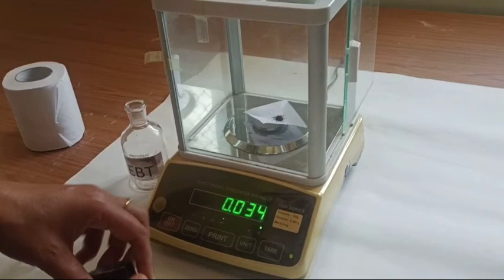So I would suggest for the researchers or the students which are preparing samples for their project works, you please do this kind of exercise while preparing the solutions. I hope you understand how to weigh on an electronic balance. Thank you all.